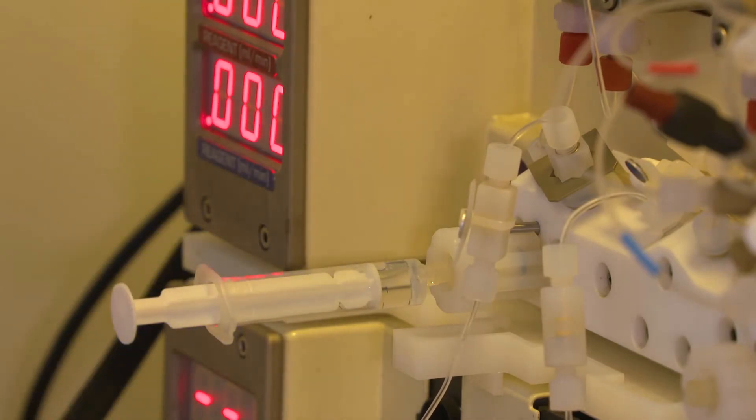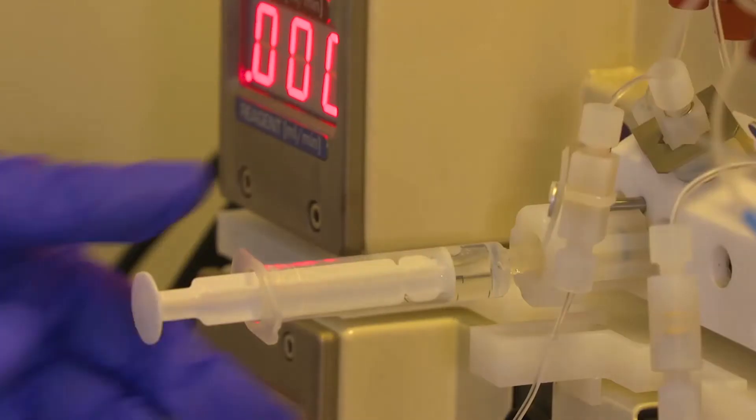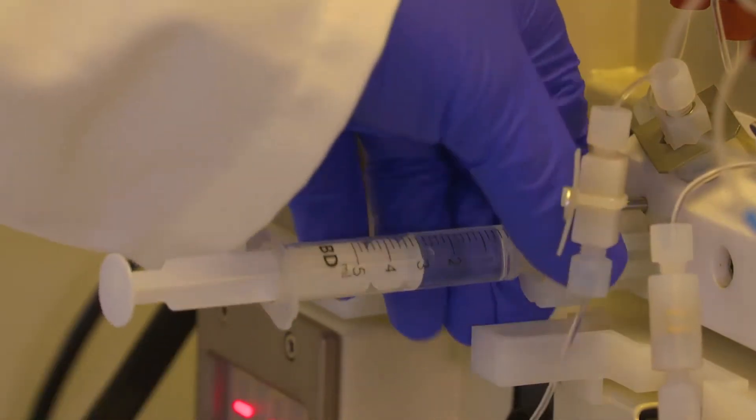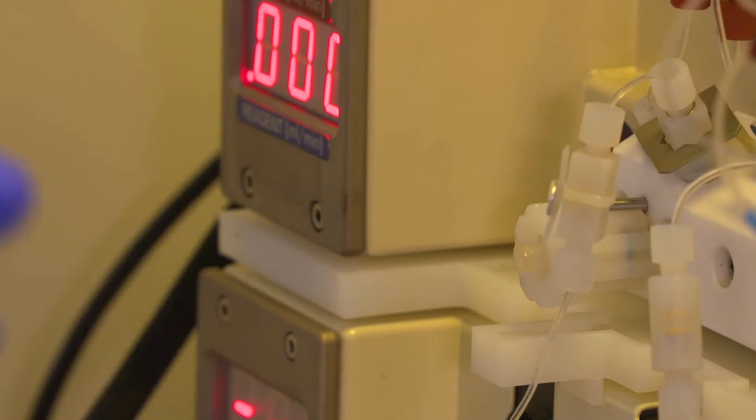Now the syringe is full, I switch back to solvent and pull through again. Then I close the valve just finger tight and put this in the waste.